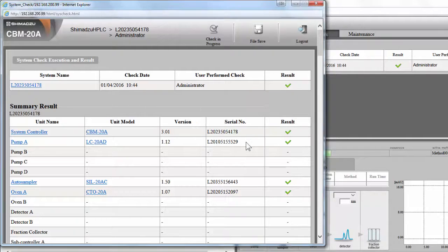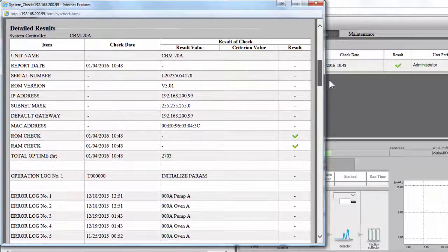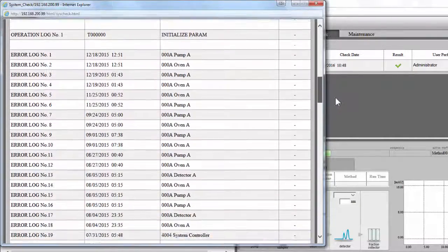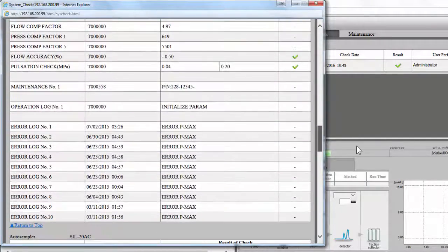Once the system check has been completed, you'll be able to see the overall results either as a green check for pass, a yellow exclamation mark for warning, or a red X for fail. In addition, you'll be shown the summary results, which show you the individual system modules as well as their system check results. As you scroll down, you will also see a detailed system check report on each individual module. This is extremely useful information when troubleshooting your HPLC system. This allows you to review not only the diagnostic results, but also useful information such as ROM version and error log.